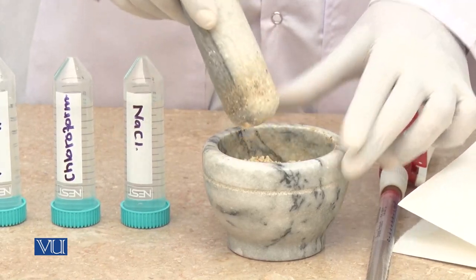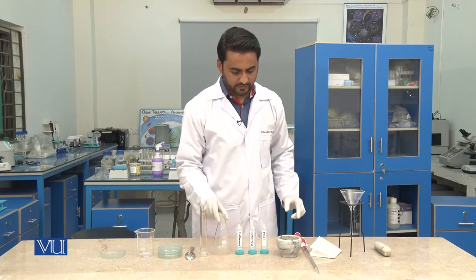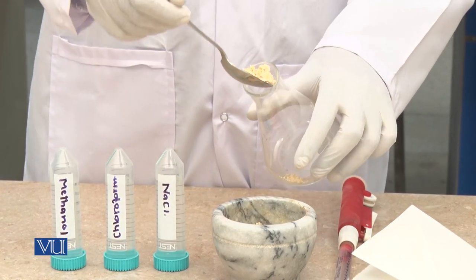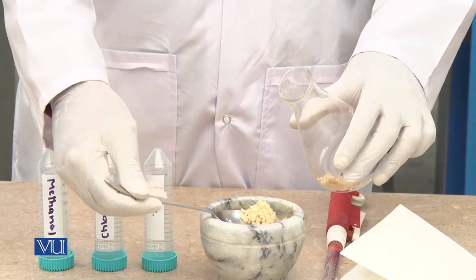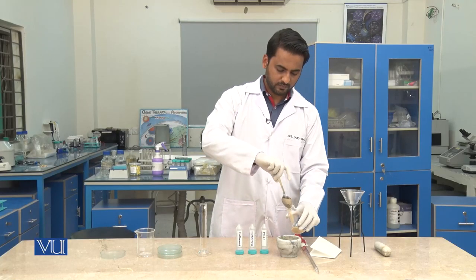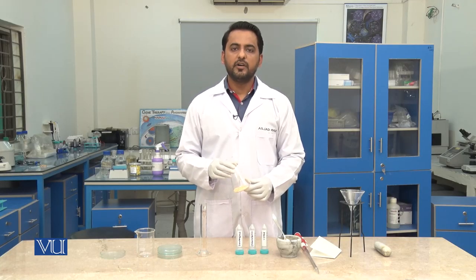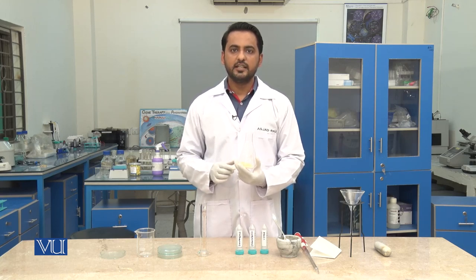Now the nuts have been ground quite well. We will transfer these nuts into the flask. Now we will add, with the help of a glass pipette, 20 ml of methanol and 10 ml of chloroform into this flask.